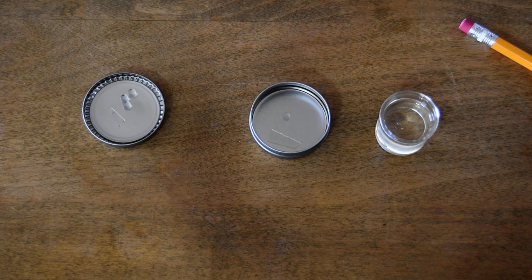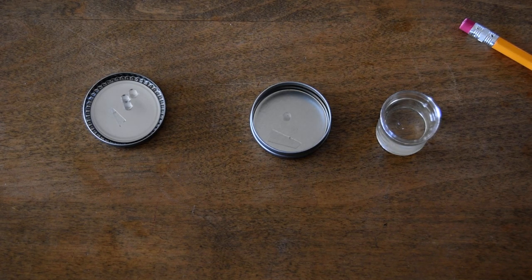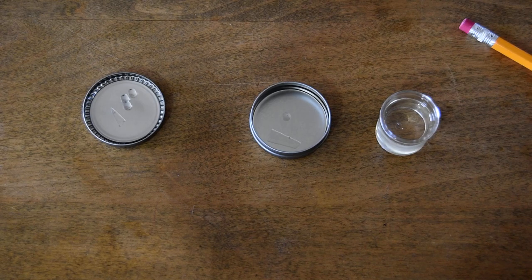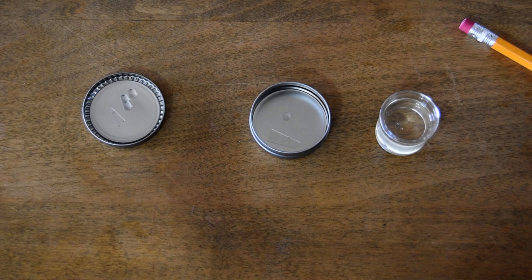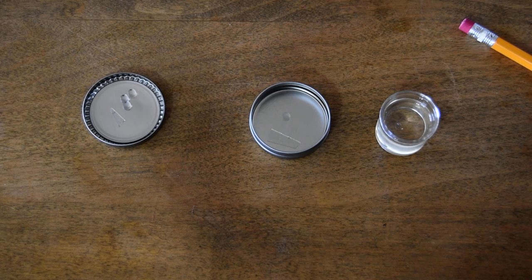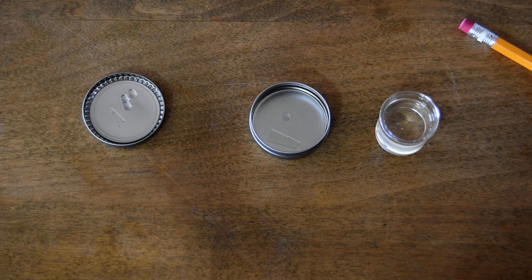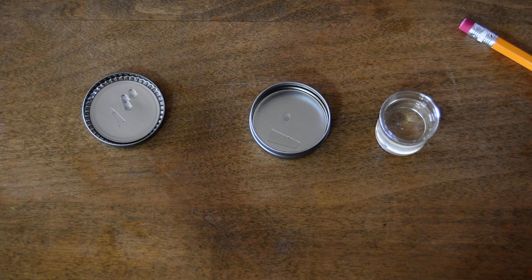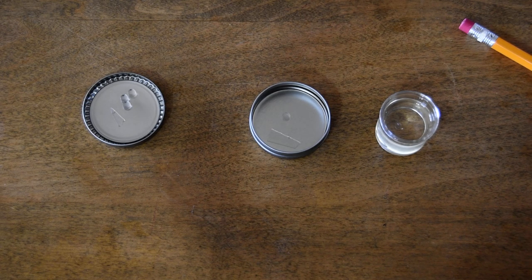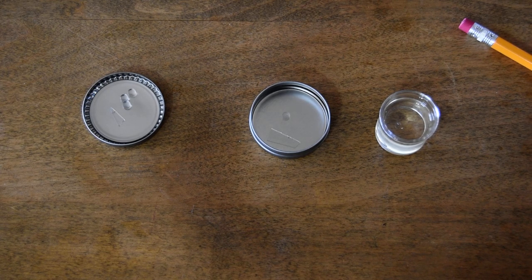For your exercise, you're going to take a couple of small pieces of your broken glass and submerge them in some different liquids, then record whether each piece of glass is clearly visible, nearly invisible, or invisible. Any glass that becomes invisible in a liquid means the liquid and the glass have the exact same refractive index. To go a step further, we're doing this on the macroscopic level with our naked eye — but we could also do this on the microscopic level. If we had even smaller pieces of glass, we could put them on a microscope slide, submerge them in oils on the surface of that slide, and make observations under the microscope. So this is the procedure you're going to follow to do the refractive index comparison using this submersion method.